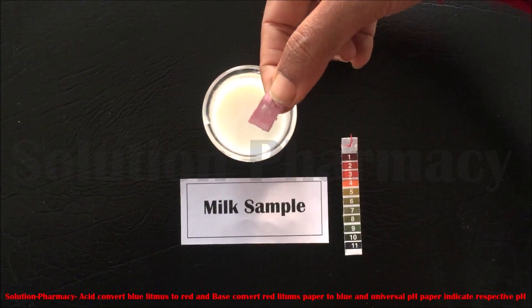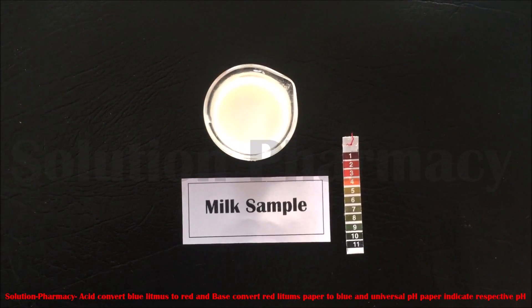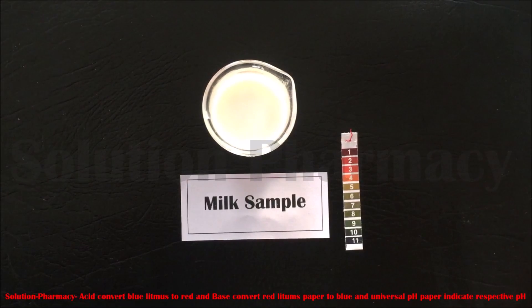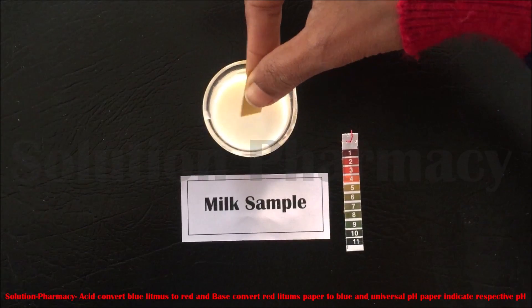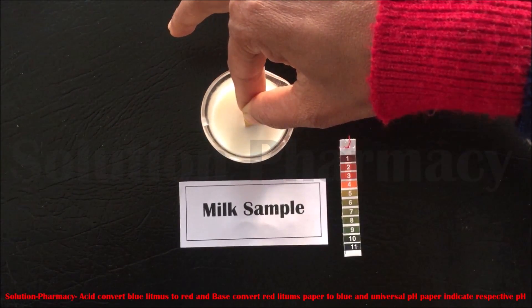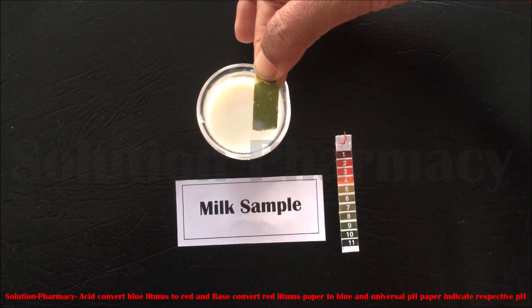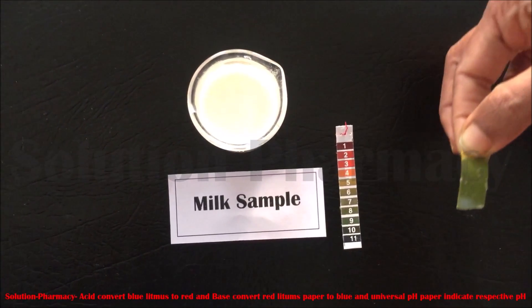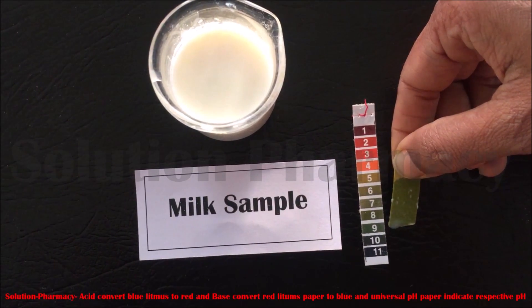Now dip the red litmus paper into the beaker containing milk. You can see the red litmus paper does not change to blue, which means milk is not basic in nature. Next, to determine the pH value of milk, dip the universal pH paper into the milk sample. After a few seconds, remove it and observe the color change. The color changes to green, which matches the value between 6 to 7, so the pH of milk is between 6 and 7.